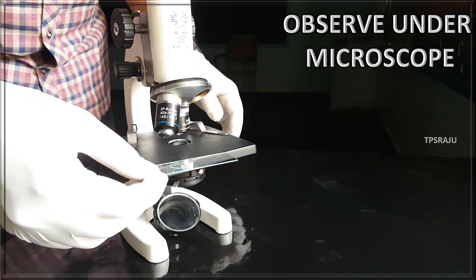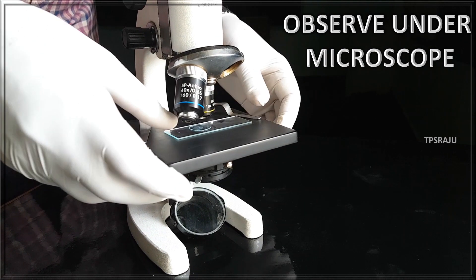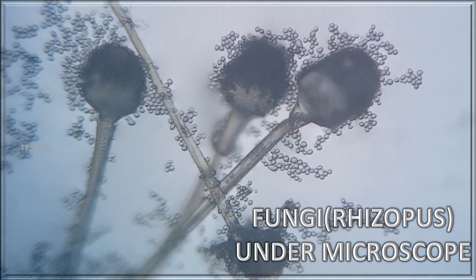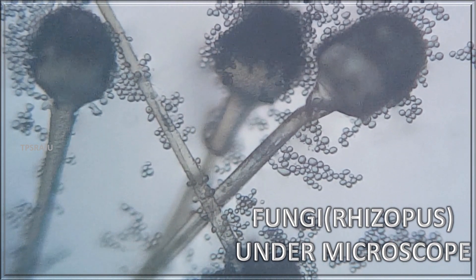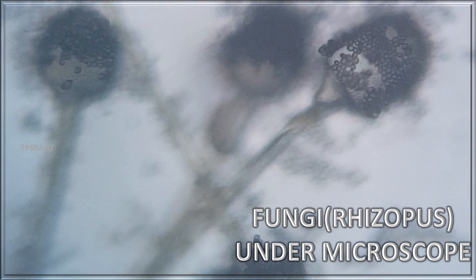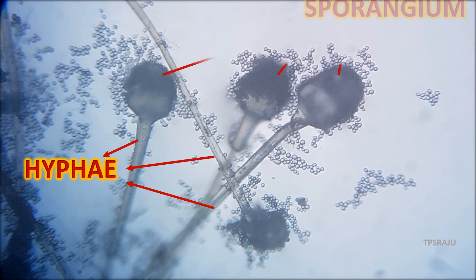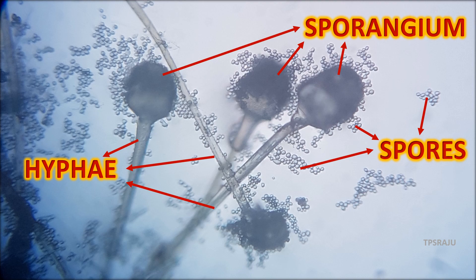Then observe under the microscope. Let us observe the structure of fungi. There are fine thread-like structures called hyphae. At the tip of each hyphae, there is a sac-like structure called sporangium. Each sporangium contains hundreds of spores. Find thread-like structures — hyphae. Sac-like structures — sporangium. These are spores.